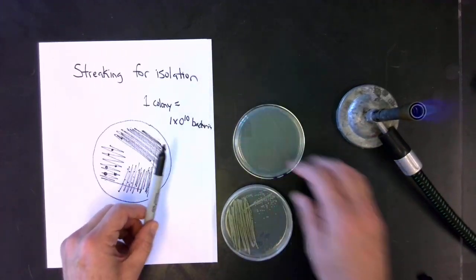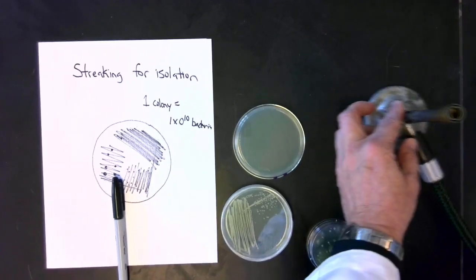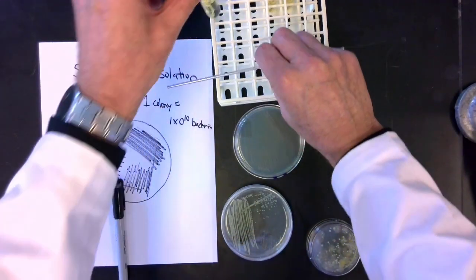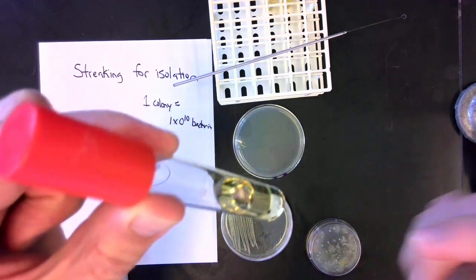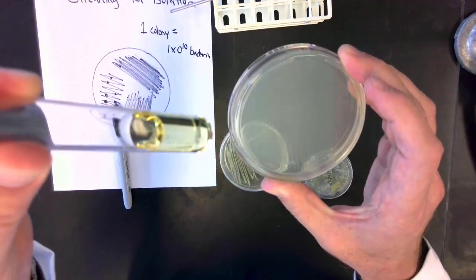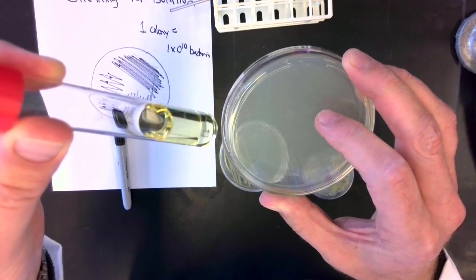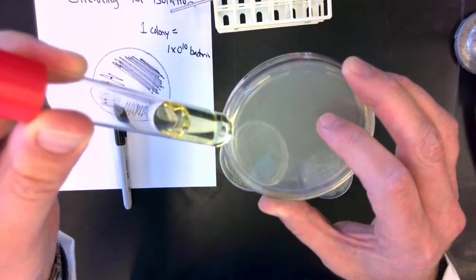For bacteria, in addition to solid media, we also have, and yeast we can do the same, liquid medium. So here's a test tube. The only difference in the nutrients between this one and this one is that this one contains agar, which doesn't help in growth, it just makes the medium solid so we can have colonies form.